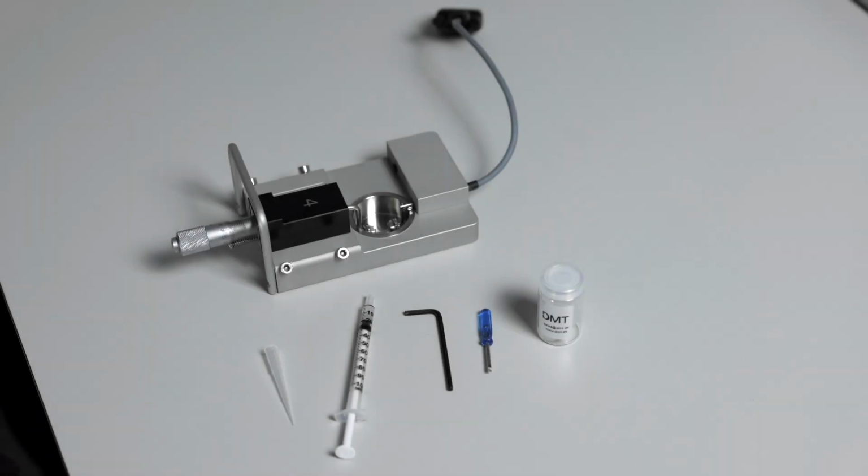In this video, we will be discussing the two ways to re-grease a transducer. The first method is a simple method and just involves applying some grease to where the transducer pin comes out of the transducer housing and where the mounting support is attached. The second way is more involved and involves removing the transducer.